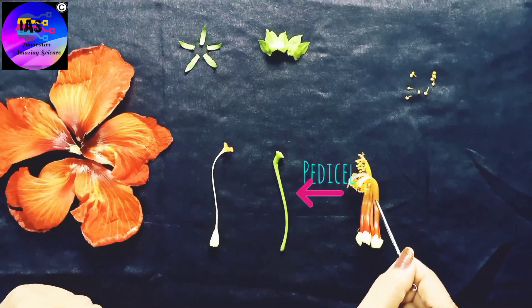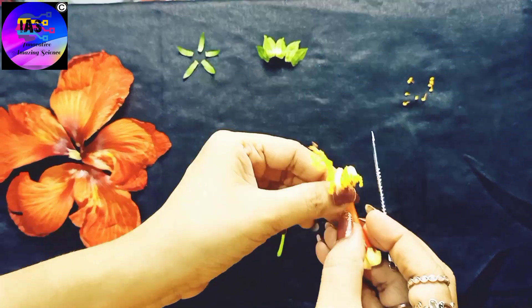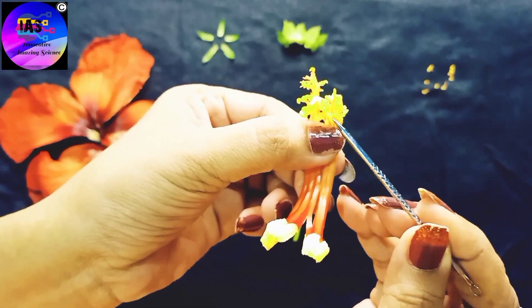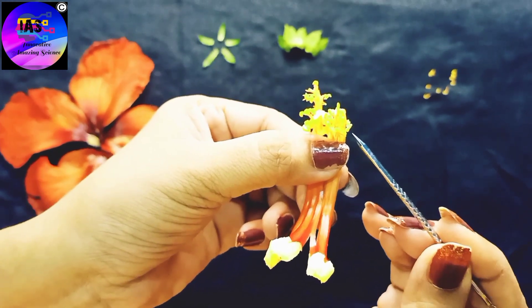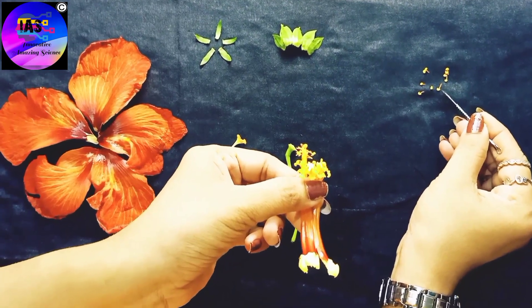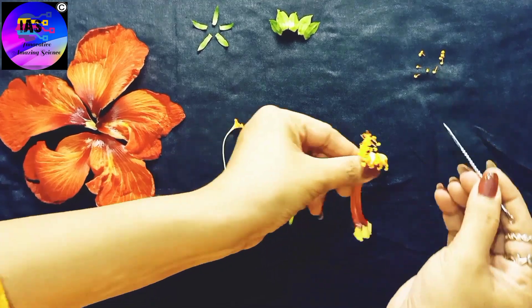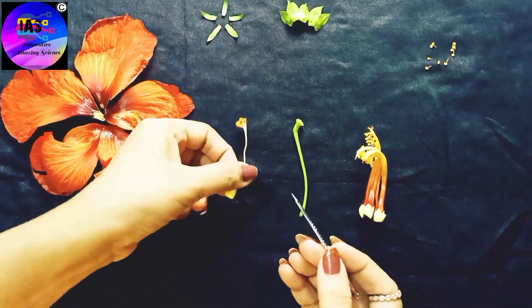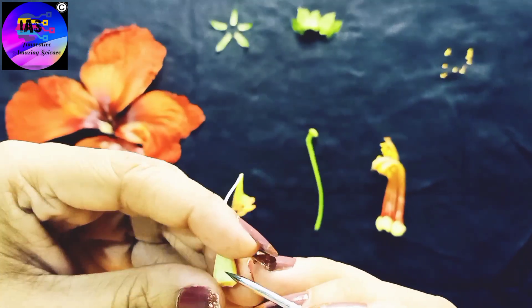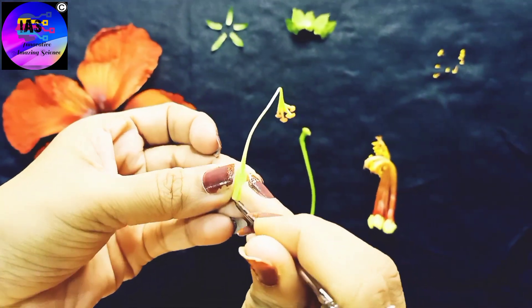This is the pedicel. If you observe closely, this is the androecium, which contains a group of stamens. Down below you can see a single stamen, which contains the anther and the filament. And this is the ovary — the swollen part at the base of the pistil.